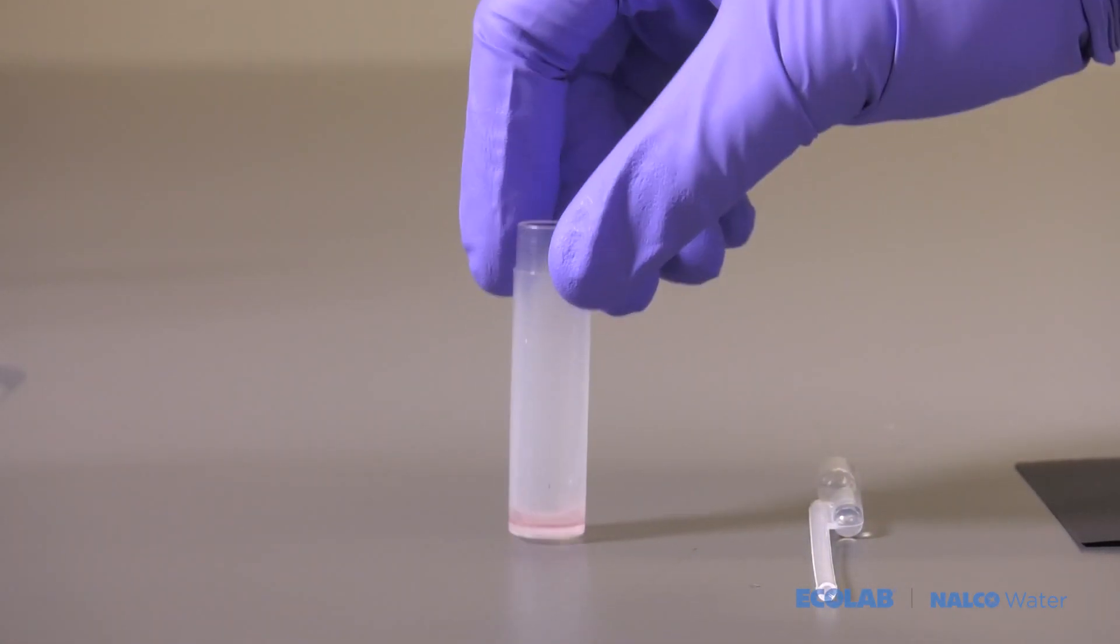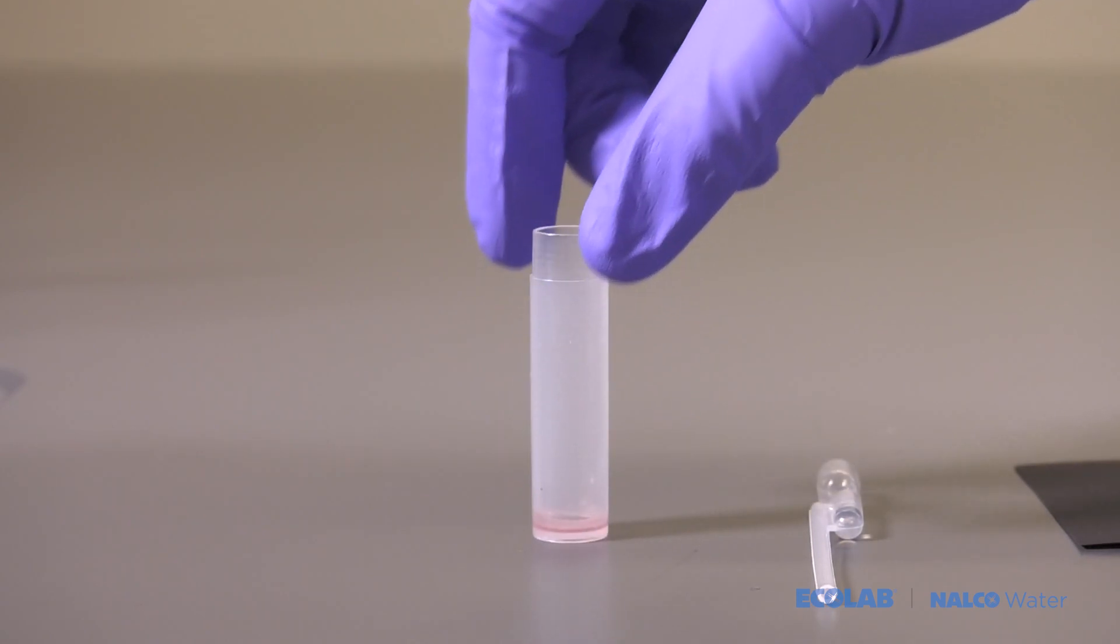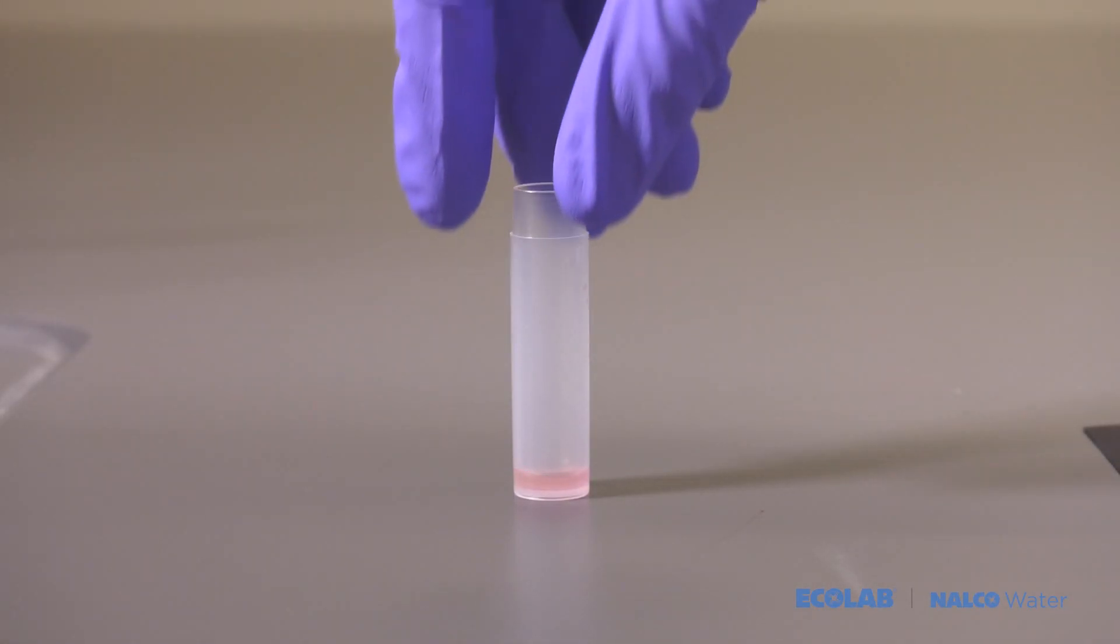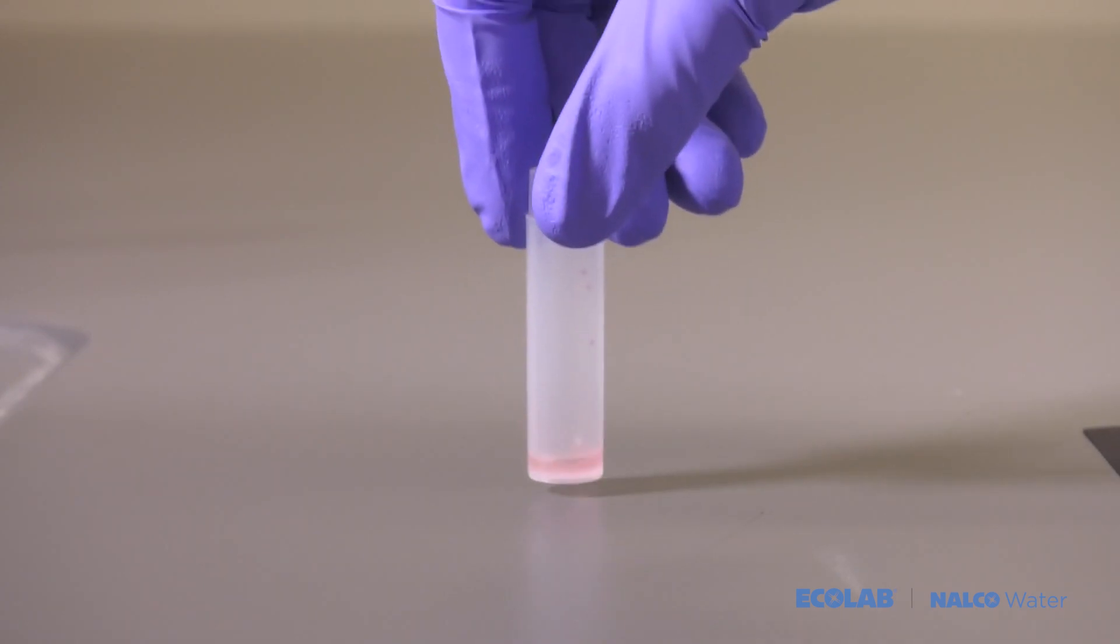Lightly tap the vial and swirl to mix. Wait five minutes, then lightly tap the vial and swirl to mix again.